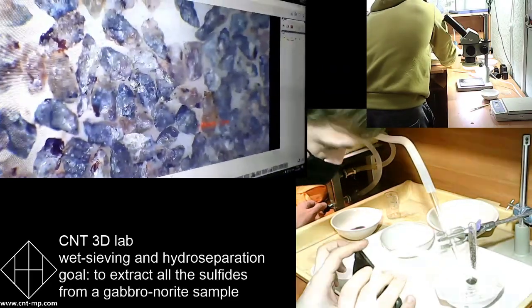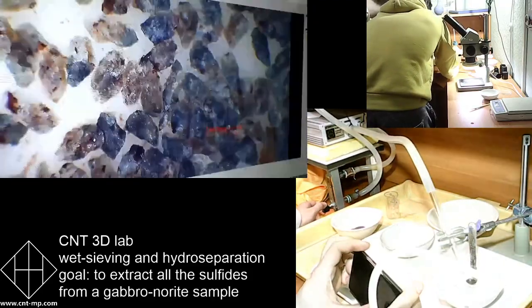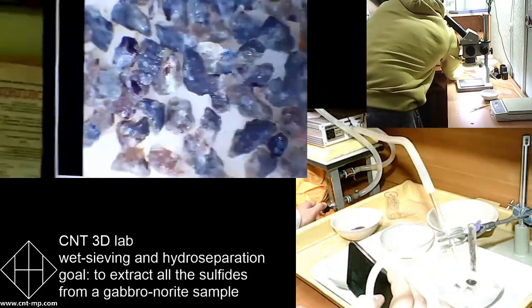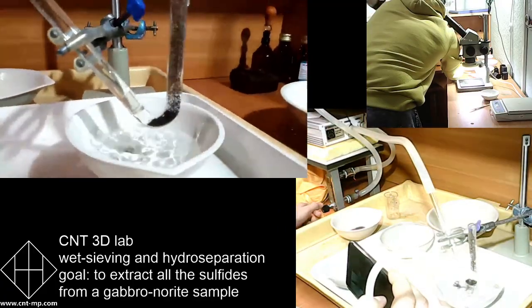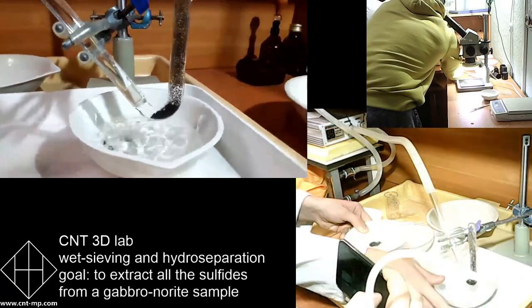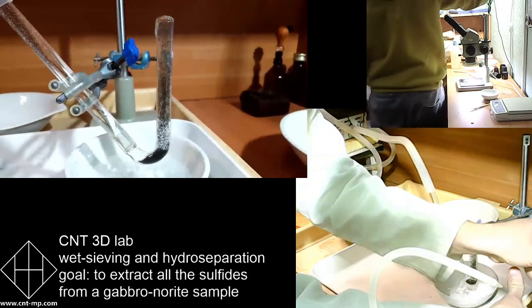You will see these particles now. Here they are. So mostly silicates. They are ideally preserved, so you can see the crystalline shape.